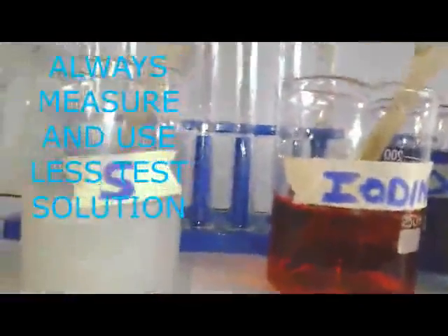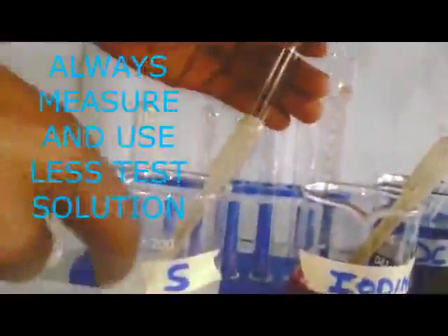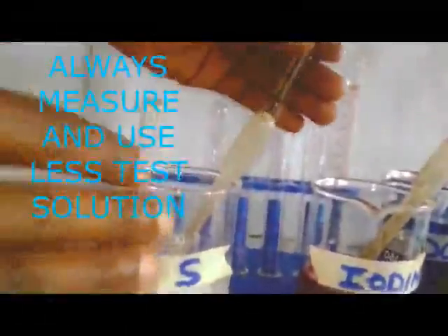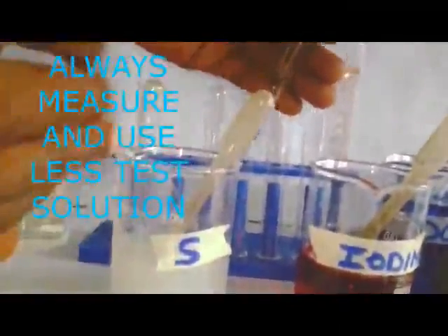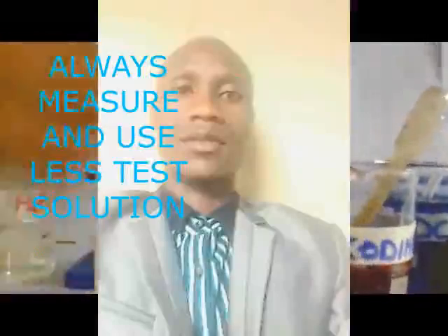Now I'm going to obtain my test tube. But remember, when you're writing the procedure for this one, they will say: to 1 cubic centimeter of solution S, add drops, specifically they can be 3 drops, add 3 drops of iodine solution. That will be our procedure. So how are we going to measure our 1 cubic centimeter? We get a small measuring cylinder, this one here.